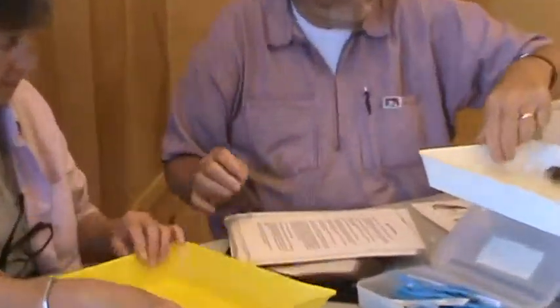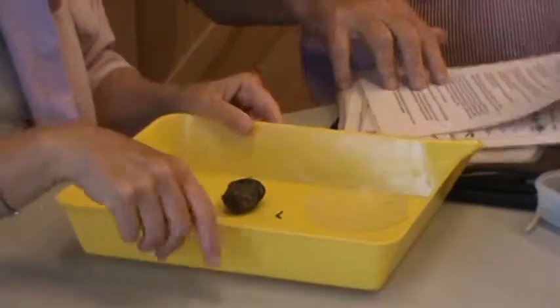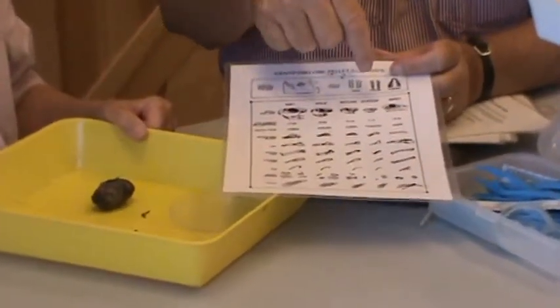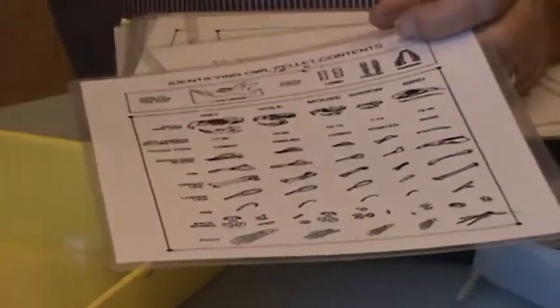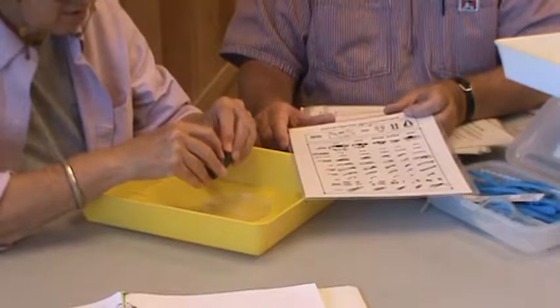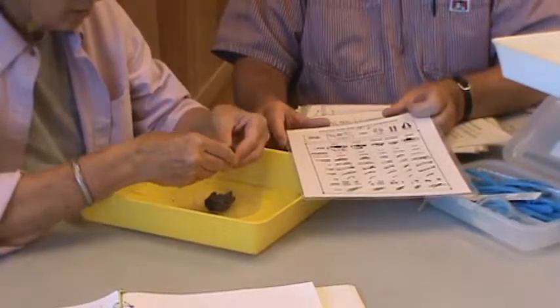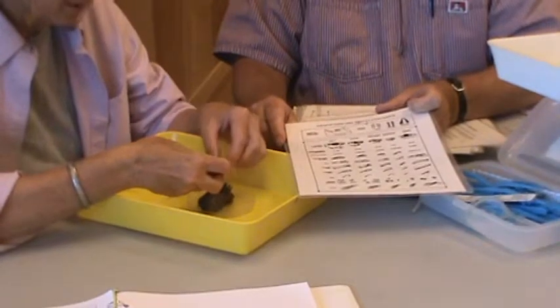So first we do the information about owls and pellets, then we do the dissection. We pass out the prepared trays with the pellet already on them. Every student — or every two students — will get a bone identification chart with a rat, vole, mouse, shrew, bird, and mole. Go ahead and pull that pellet apart using just your fingers. You won't ruin too much. Oh, I see some bones already!